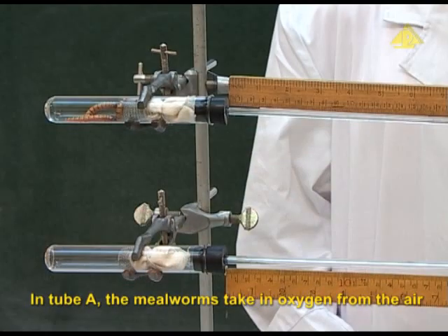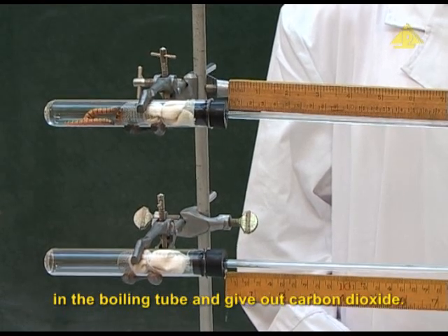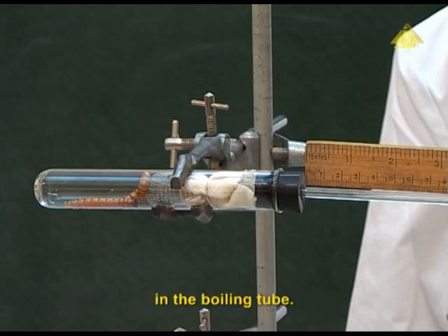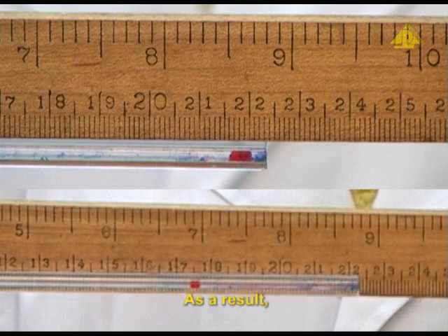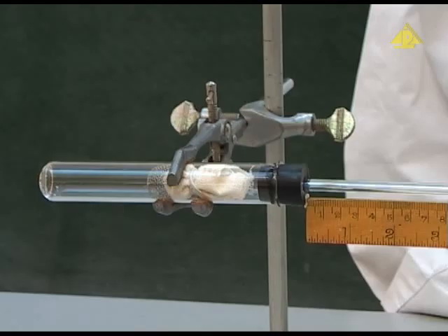In tube A, the mealworms take in oxygen from the air in the boiling tube and give out carbon dioxide. The soda lime can absorb the carbon dioxide in the boiling tube. The total amount of gases in the boiling tube decreases. This causes the gas pressure inside the boiling tube to decrease. As a result, the red ink marker moves towards the boiling tube.